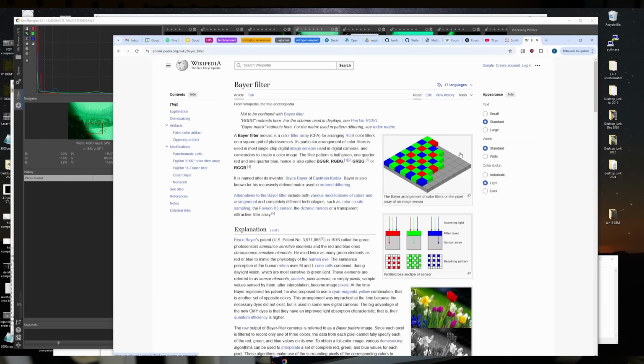So it seems like it would work to just use the red sensors only and just take only the red channel. But this doesn't work because what we're doing is subsampling the image, and if we interpolate between red pixels, it's possible that we're going to make an incorrect assumption. Remember, this technique is super sensitive to every little nuance of the image. Movements of hundreds of microns, different angles in camera and illumination, a pixel being off by just a few values. It's really, really very sensitive. And so I tried my best to use a single channel, and it doesn't work. It will not reconstruct the image at all.